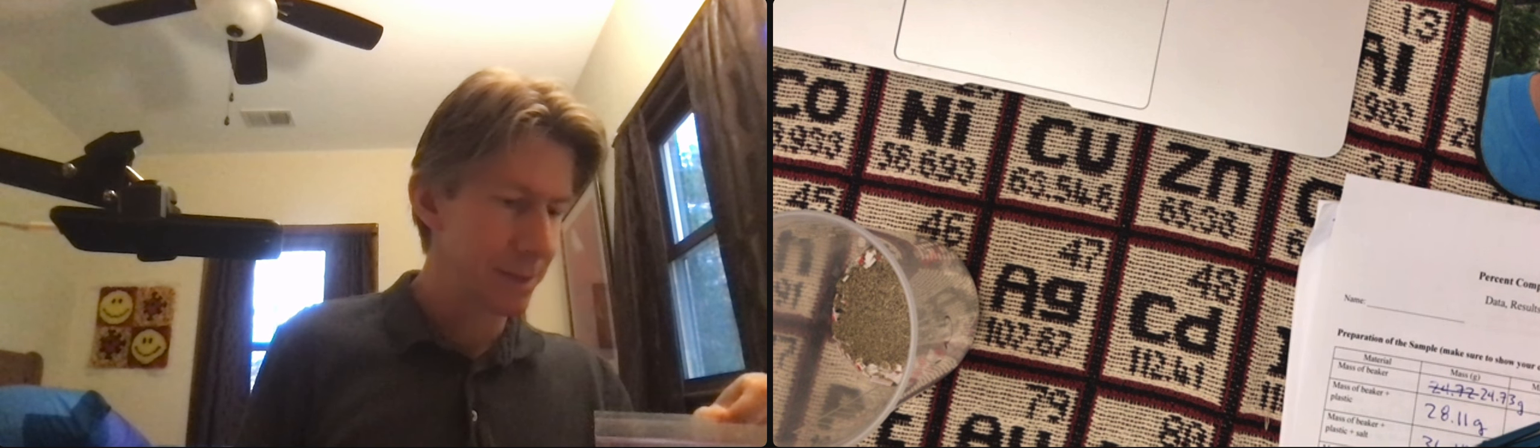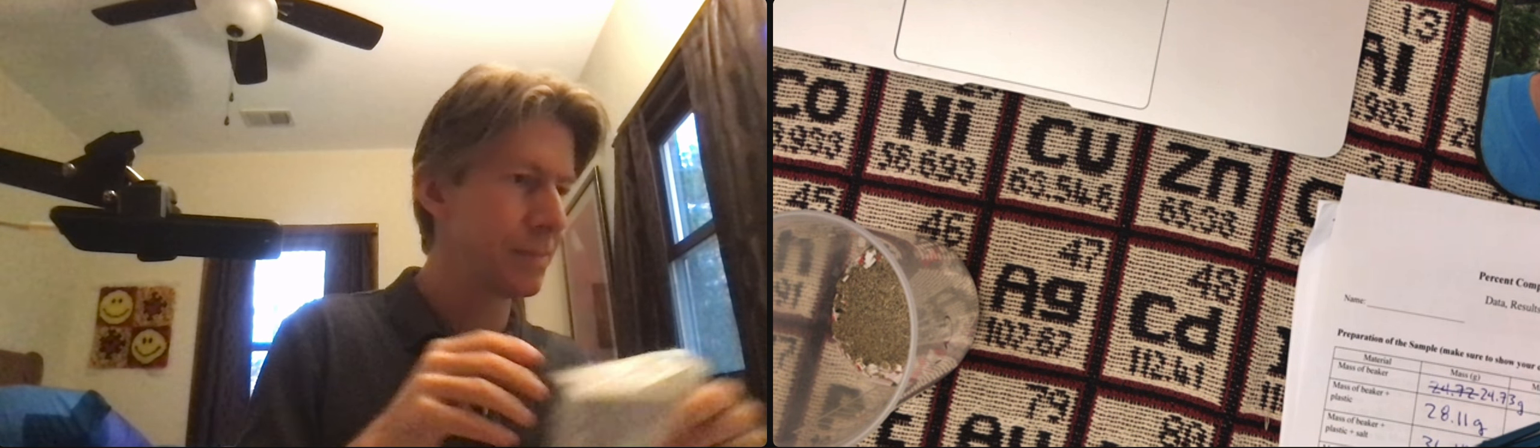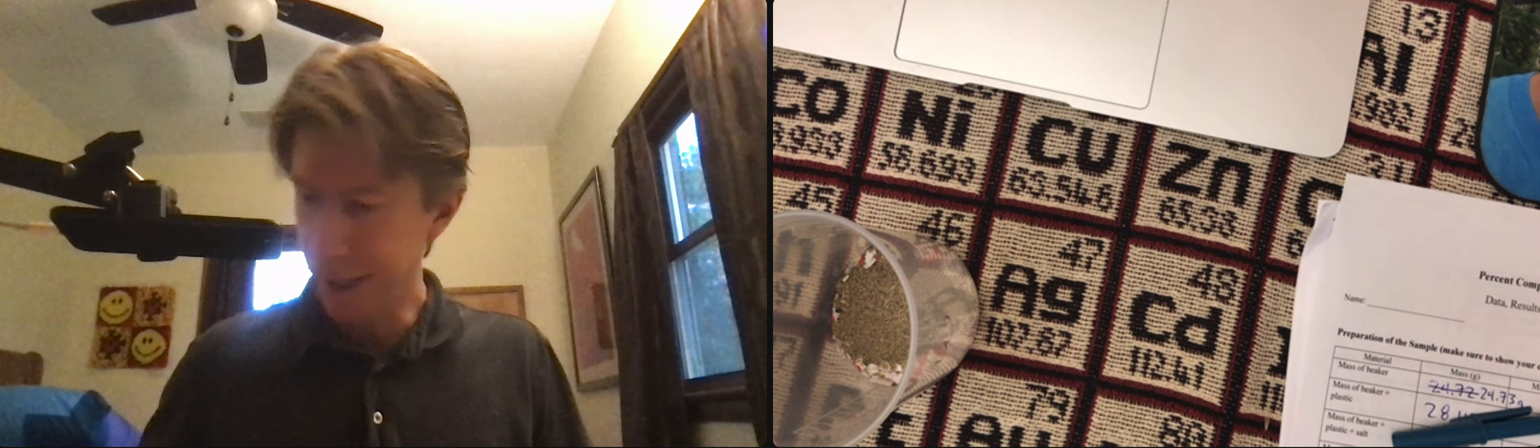Pour that in. I'm going to close my sand up. And weigh it again.